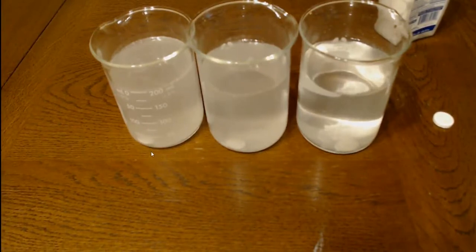See how it moves around? So it's become so light that the bubbles generated underneath it can push it around fairly easily. These two are heavy enough that they're not really being pushed around. But yeah, you can see it's just getting eaten away, and pretty soon it's going to be gone.